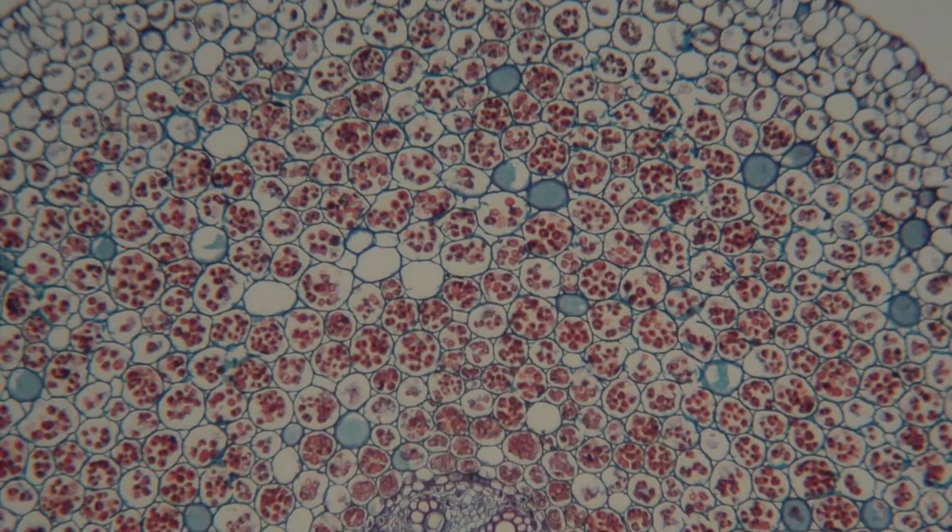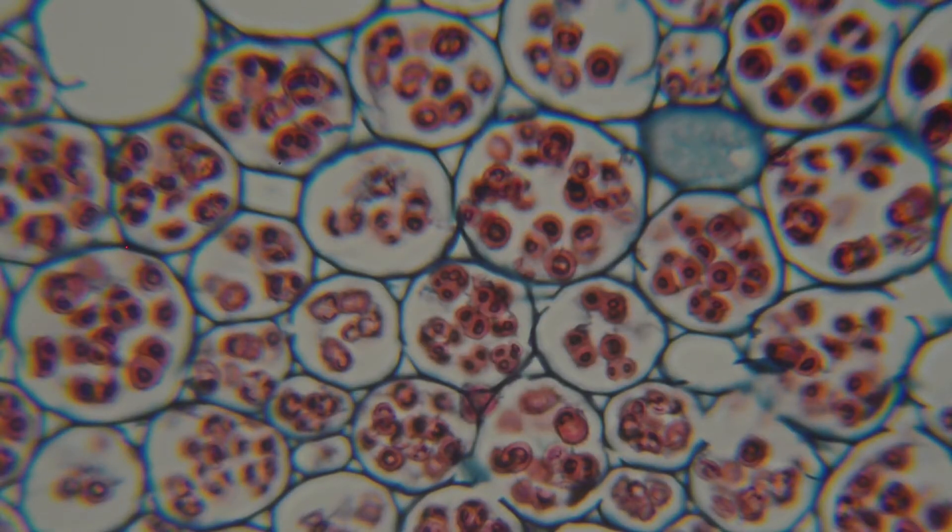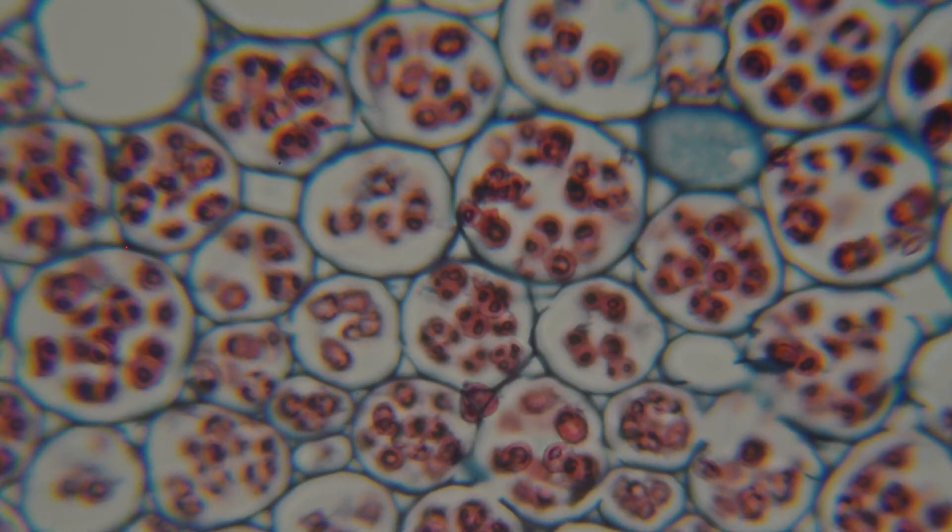Now I'm going to zoom in a bit more to see if you can see these phloem cells a bit clearer. There's mostly phloem here, and xylem usually elsewhere.